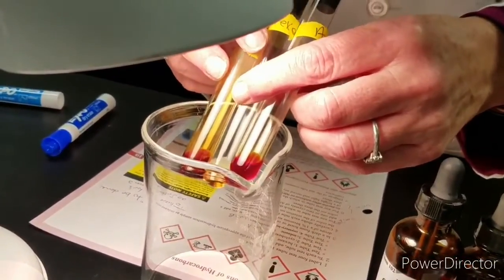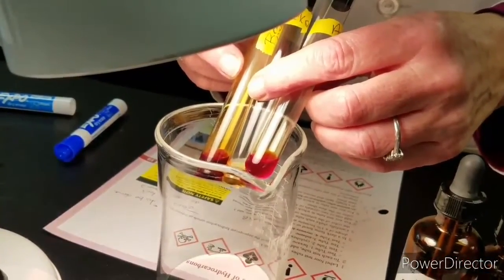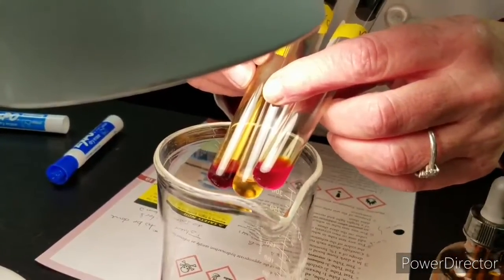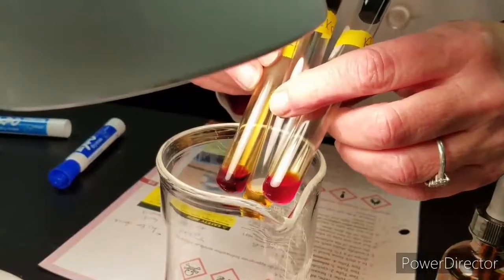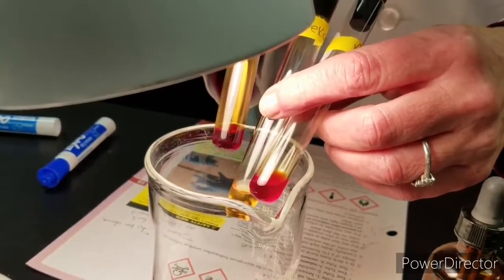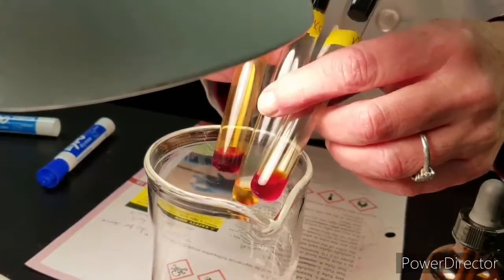After about 10 minutes under the light, notice that hexane changed to a lighter orange in color. Here's the bromine by itself, which is nice and dark orange. Hexane became a lighter orange.